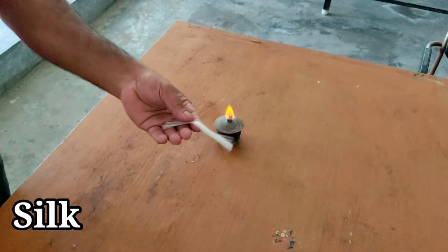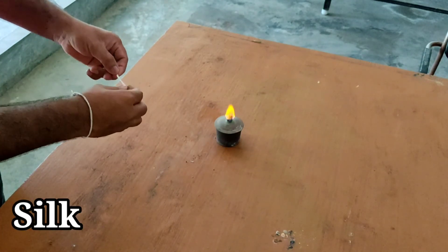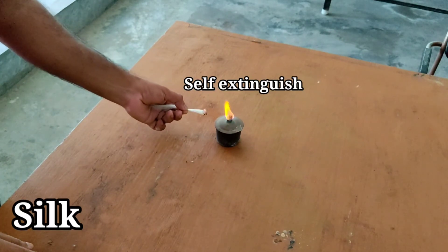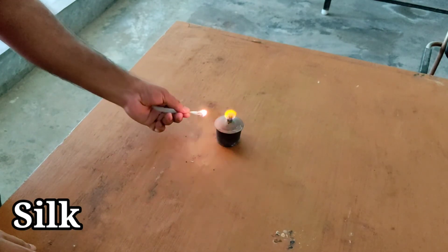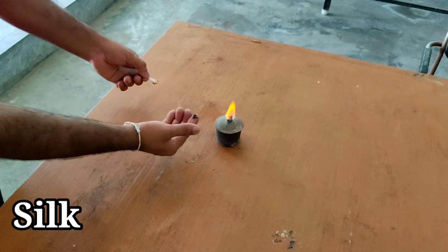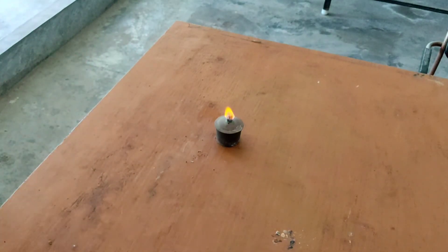Demonstrating with silk yarn: when contacted with the flame, we observe the silk yarn self-extinguishes — it stops burning when the flame is removed. The residue is black and can be crushed into a black powder.